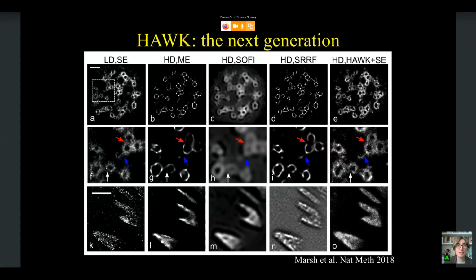But when we look at the alternative method, you can see that we're seeing a lot of sharpening when we use the multi-emitter fitting methods, and that's exactly what we'd expect from the fact that when you have multi-emitter fitting methods, you tend to have a silent failure at some point, and at some point the fitting won't be accurate. So we're getting structures which are much sharper than they would be in real life if we were actually imaging them accurately. We're not seeing the structure as it really is in the sample.